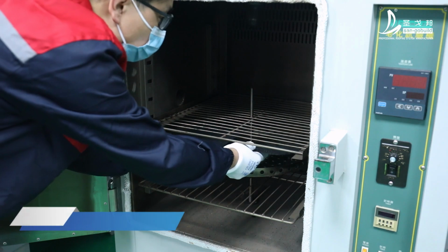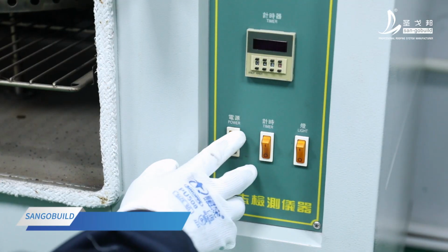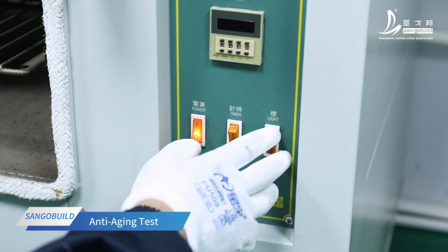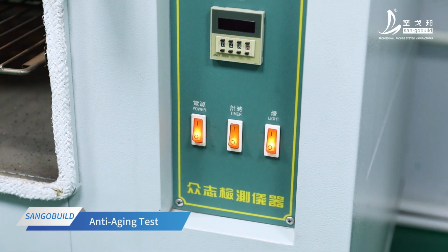The laboratory technician carries out an aging oxidation test on the sample. Put the sample into the machine. Start the machine for testing.